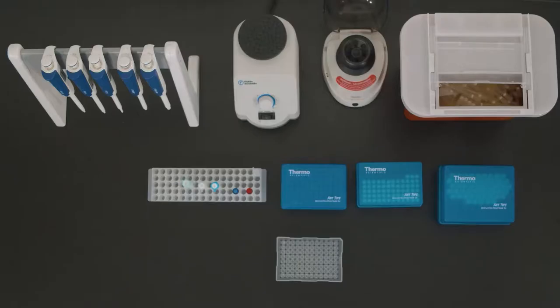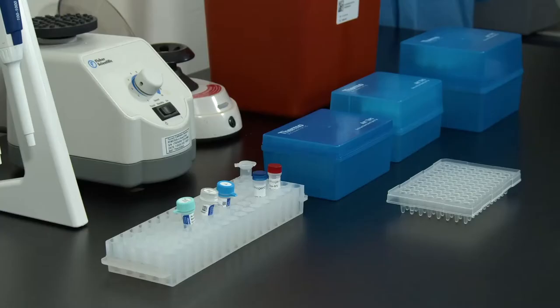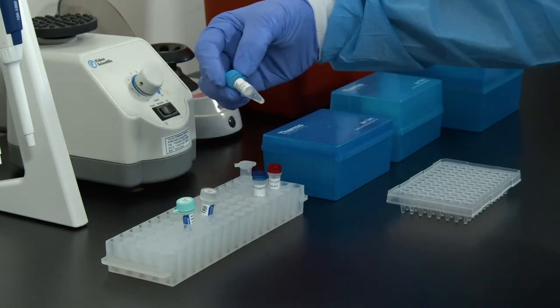Prepare the MasterMix in a sterile tube according to the number of reactions being run. After all the MasterMix reagents have been added, pipette the AMV reverse transcriptase into the solution.